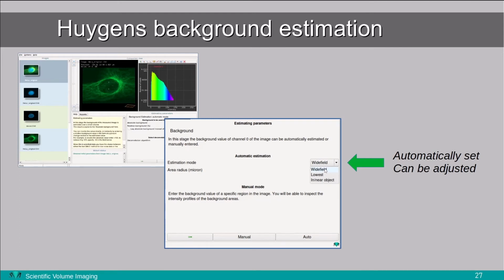We have a wide field mode, so that looks then in the focal plane. We have a lowest mode that is by default in non-wide field images, and we have an in-near object mode, and this you can select if you want to. So then you assume probably that the background is higher, closer to your object of interest. And if we hit now the button auto, then Huygens will come up with the optimized background value, and you can check that in our software. And of course you can enter values also manually.